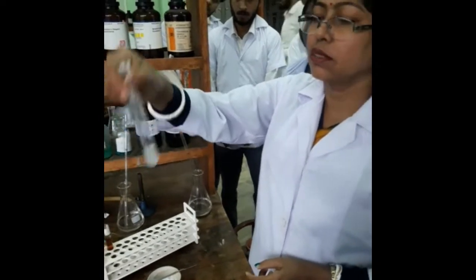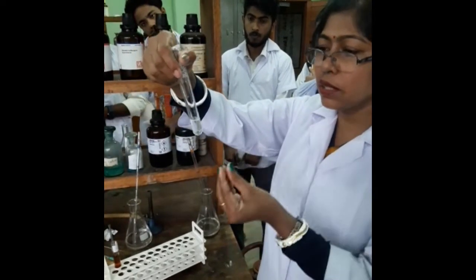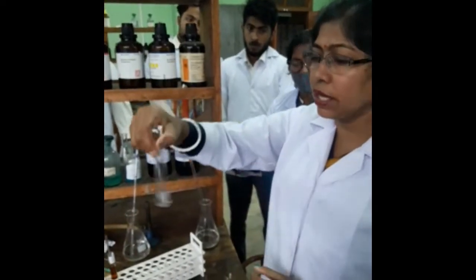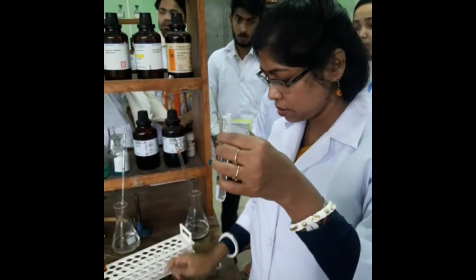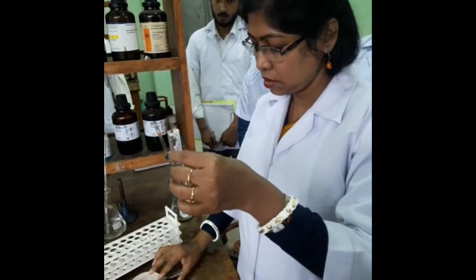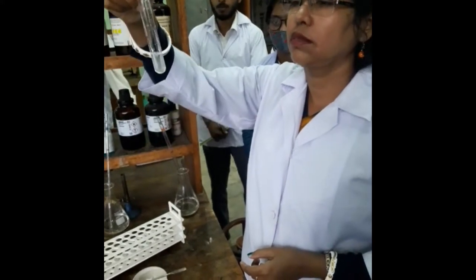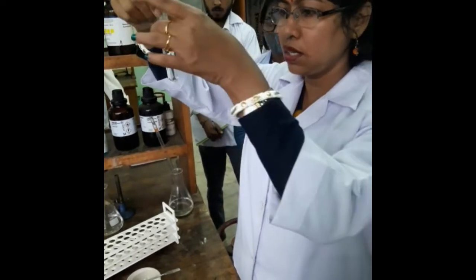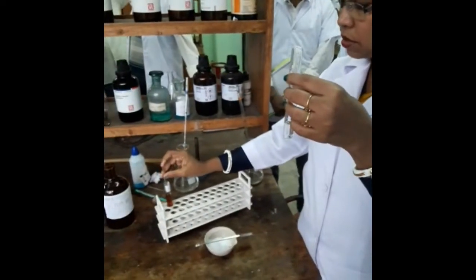Not precipitation — it is the fact of saturation. When it is dissolved, the solution is at the saturated point. I think now the solution is saturated. Now I will add 2 to 3 drops of freshly prepared sodium nitroprusside.